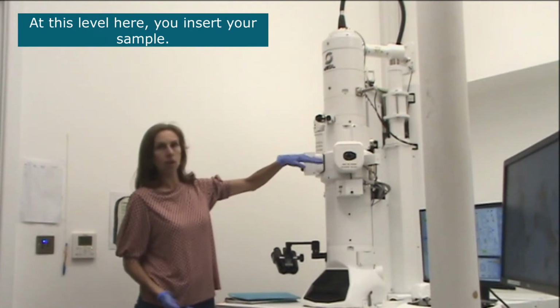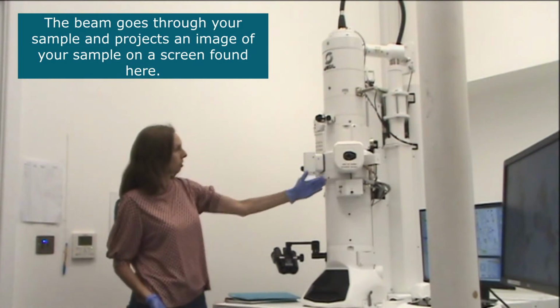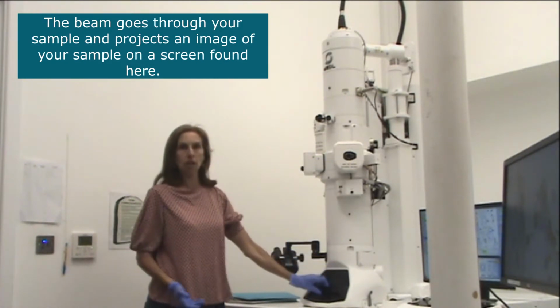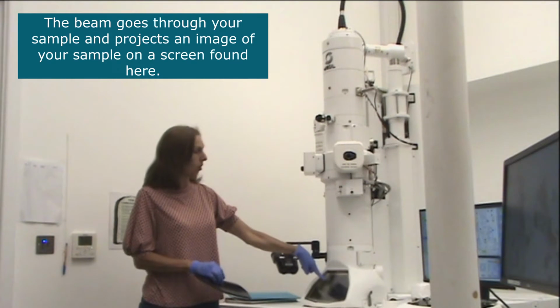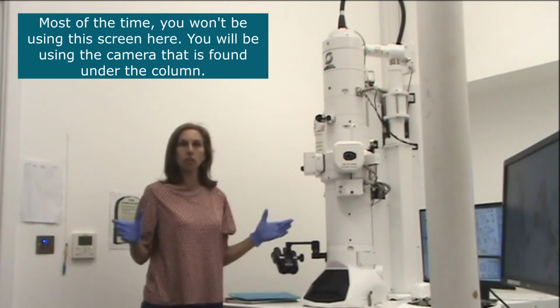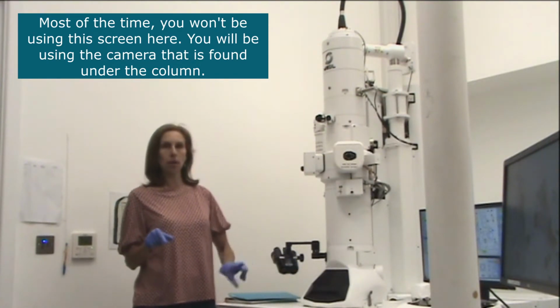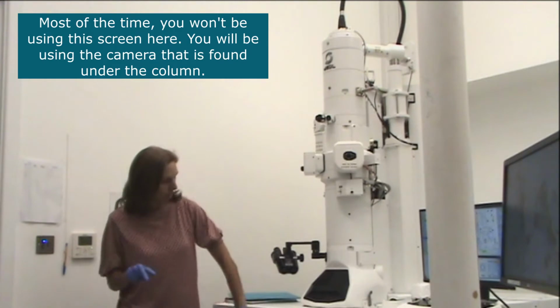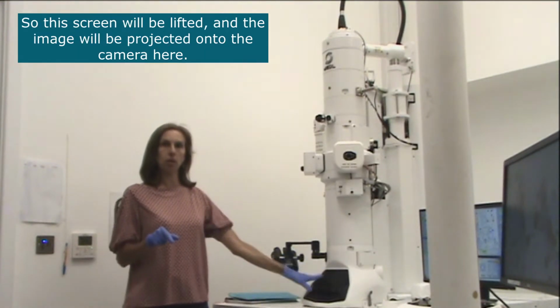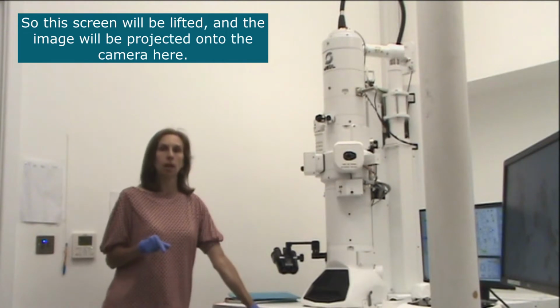At this level here, you insert your sample. So the beam goes through your sample, and then it projects an image of your sample on a screen found here. Most of the time, you will be using not this screen, but the camera that is found under the microscope. So this screen will be lifted, and then the image will be projected onto the camera here.